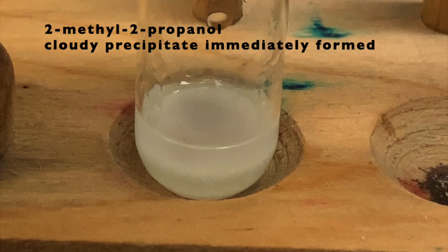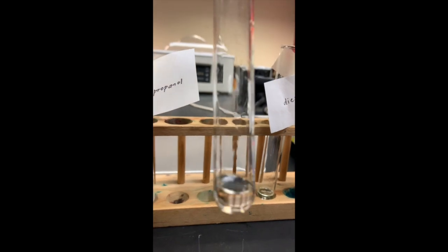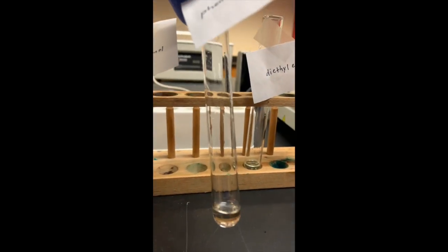Next we have our phenol. Nothing happening there. That is also clear. I'm not going to bother heating that one because even if I heat it, I'm still not going to see any change.